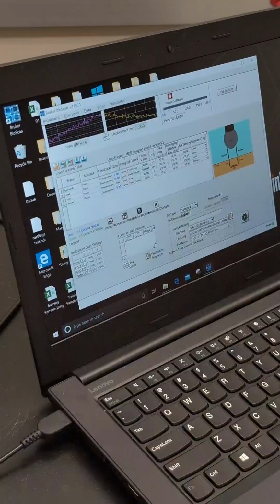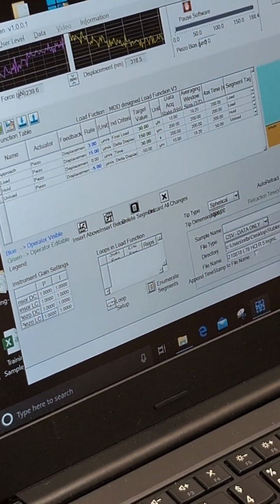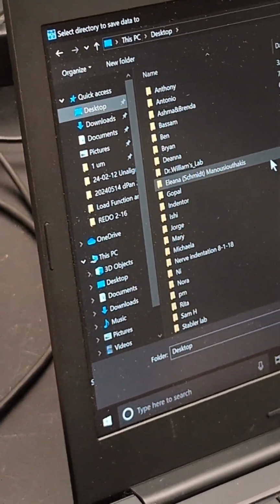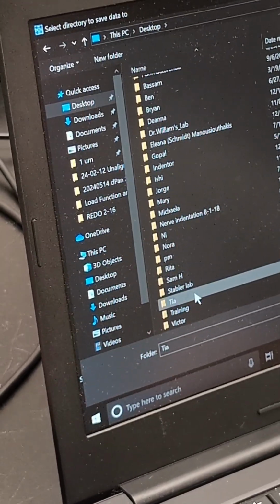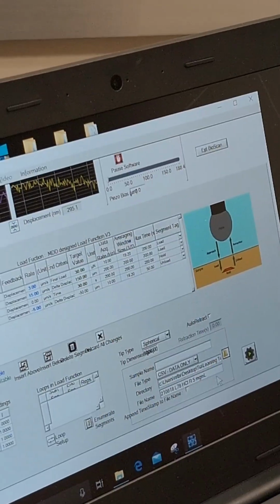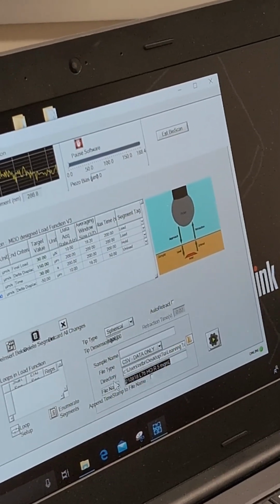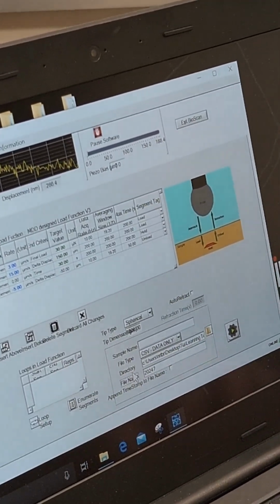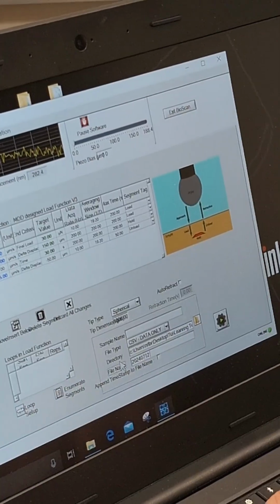Let's try the next. The location and the name. Once you set it once and it's successful to run the file, it will save everything under the designated location that you want it to be. So this will be in the tier file. So just save here. Whatever file name you want to type in, you can just put the date, that will be 2024 7/12. Test 1.